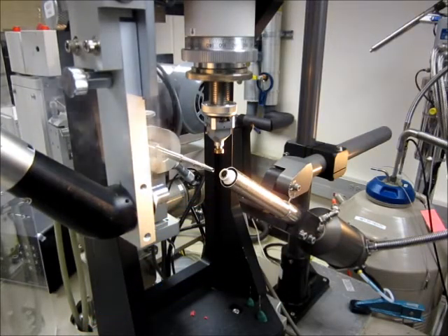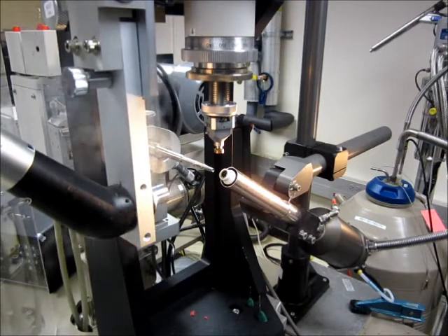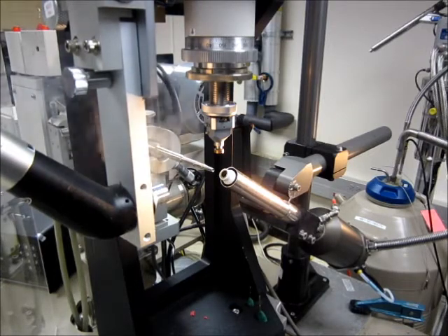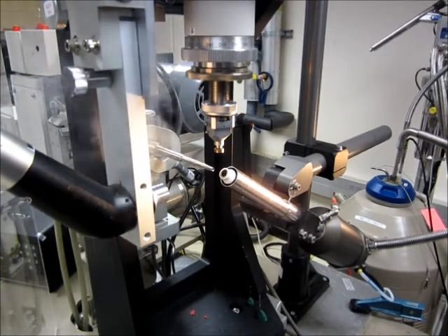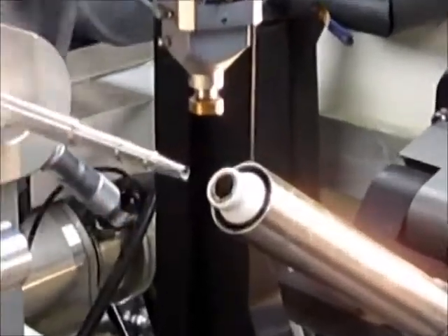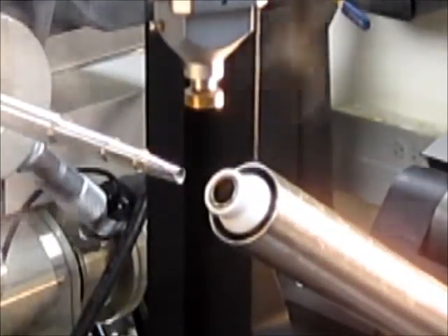In order for you to see clearly what is going on I am going to zoom the camera closer to the goniometer magnet. This way you can appreciate what is going on.